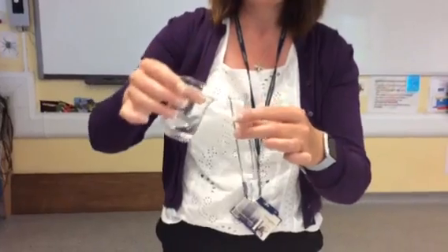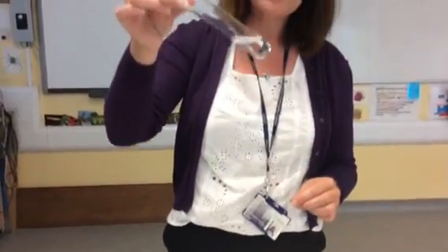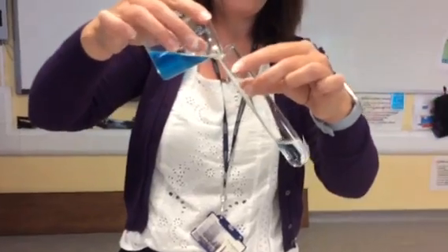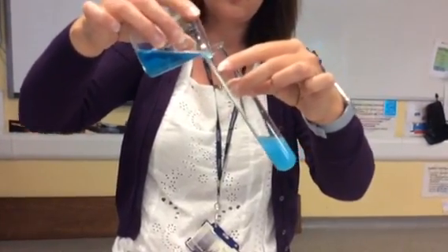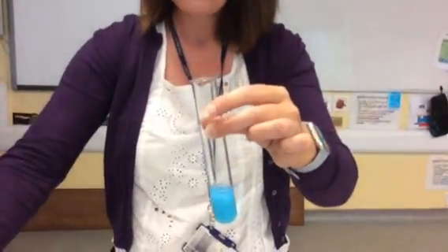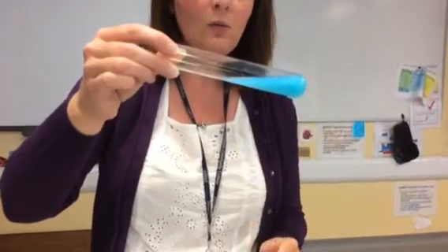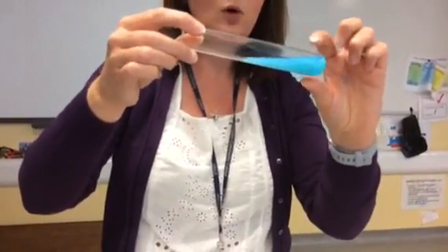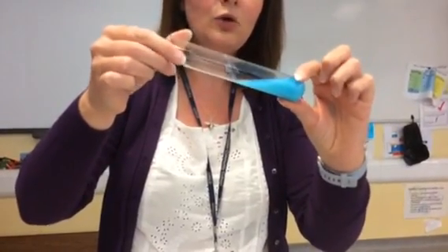So we're going to put some ammonium hydroxide into our boiling tube. So we've got this colourless solution in here. And then we're going to add in some of our copper sulfate solution. So if we pour in some of our copper sulfate solution, so at the beginning there were both solutions, and now what we can see is that we've got some very small solid particles inside our boiling tube.